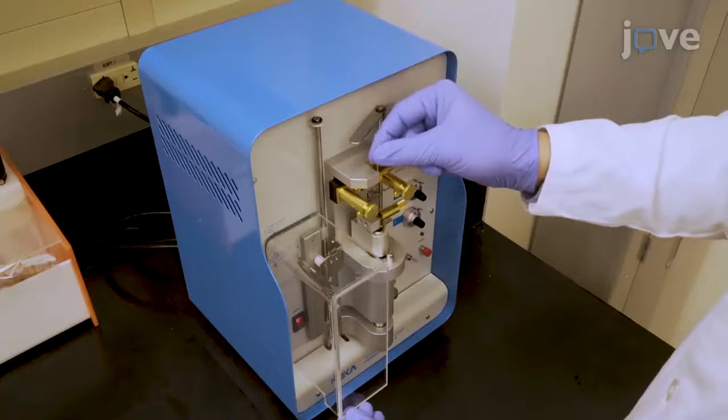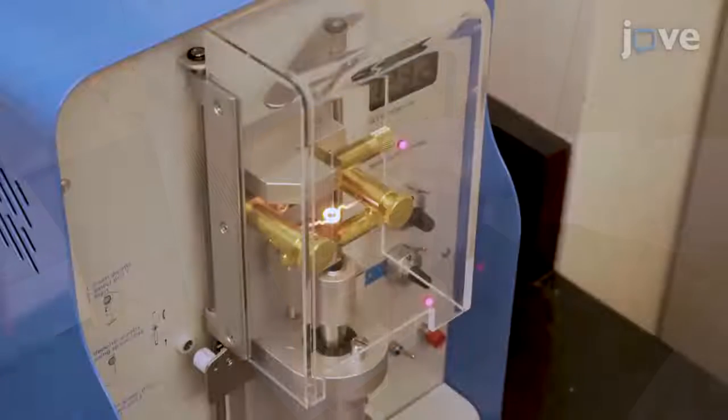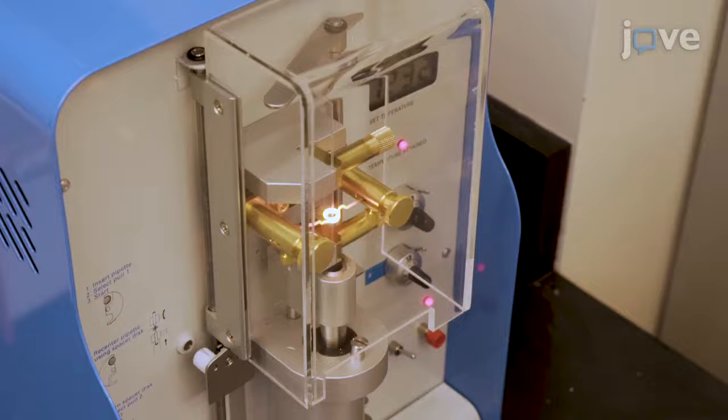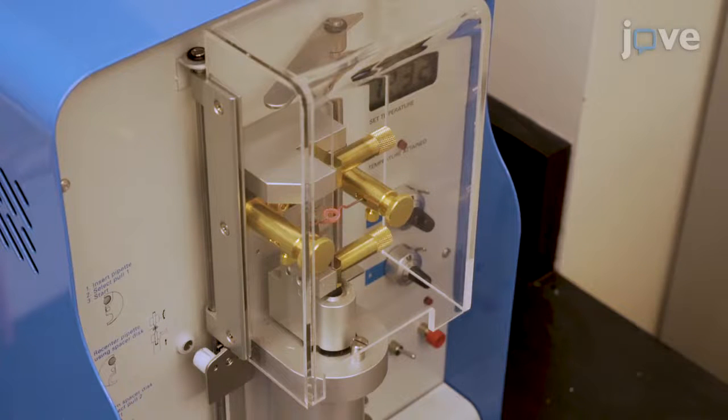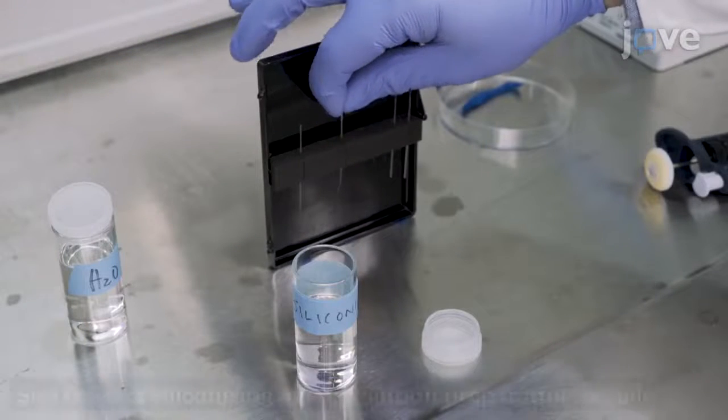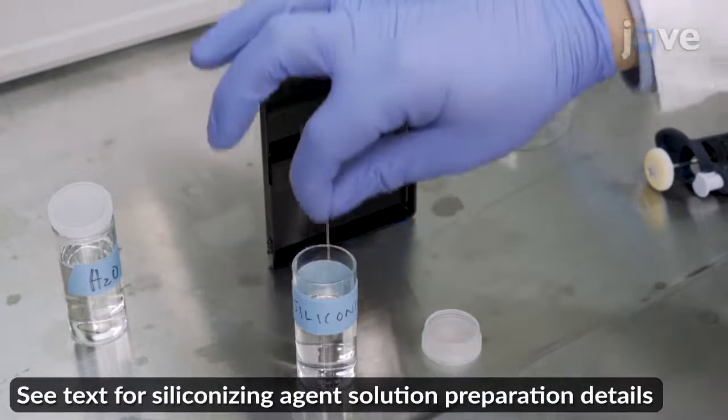24 hours before the implantation, pull glass capillaries on a micropipette puller according to standard protocols, and dip the capillaries in siliconizing agent to coat the external surfaces of the needles.